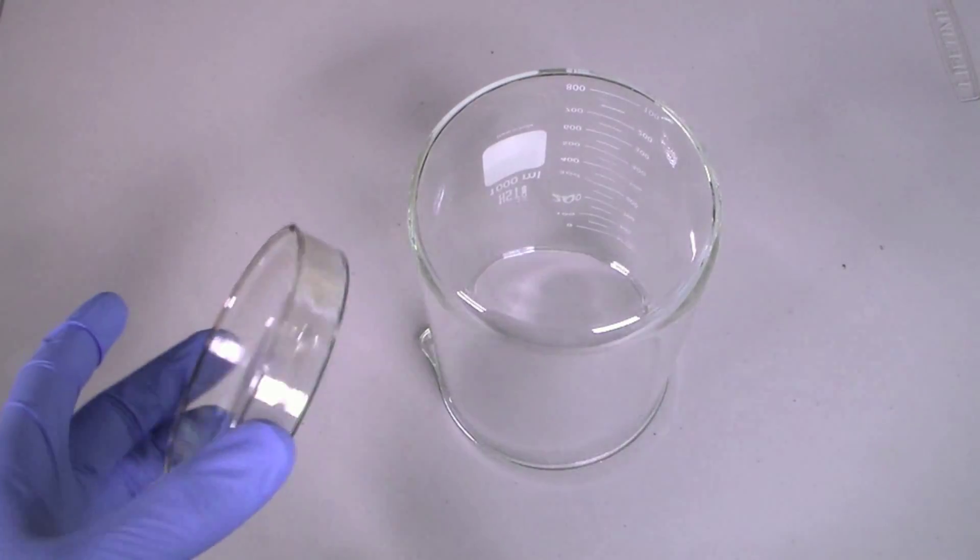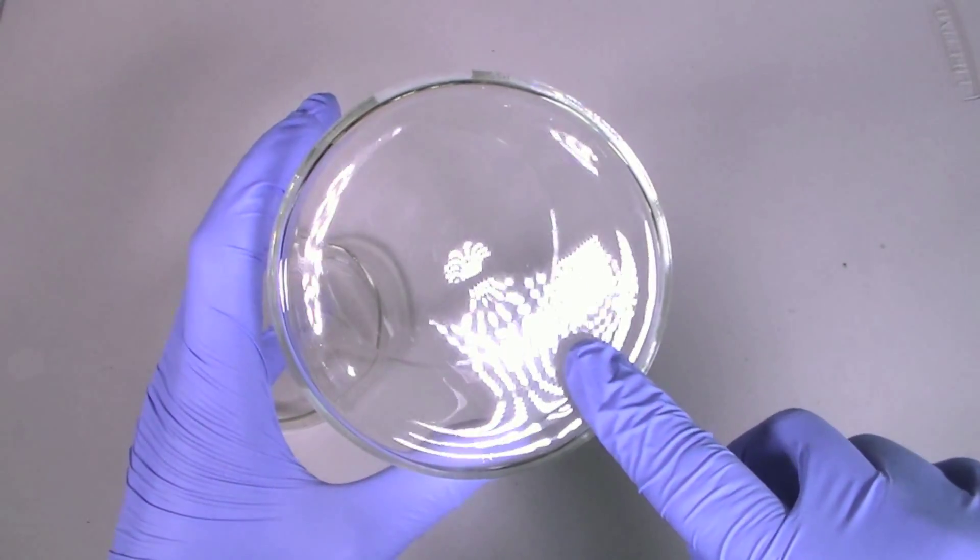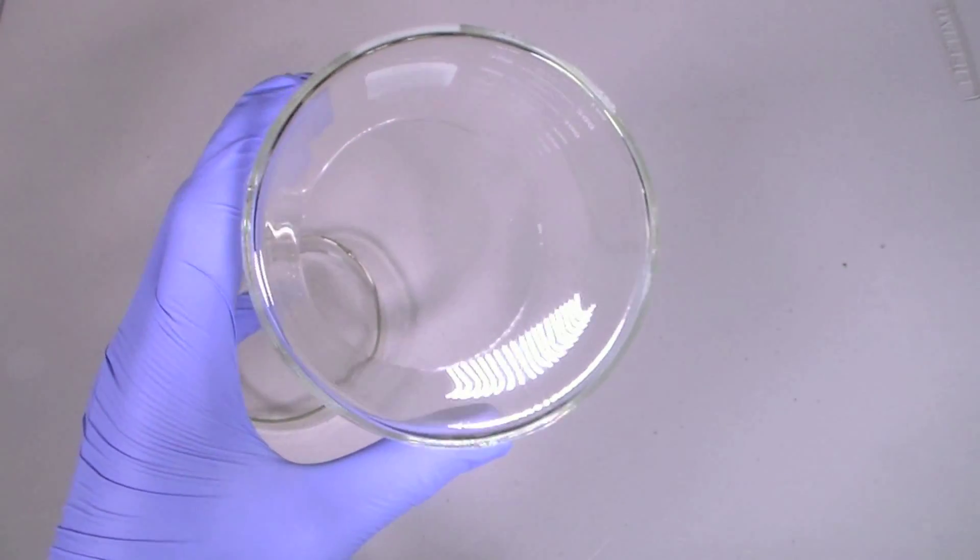In terms of equipment you will need a glass petri dish and a surface that can handle the high temperatures. In this case I am using the bottom of a glass beaker.